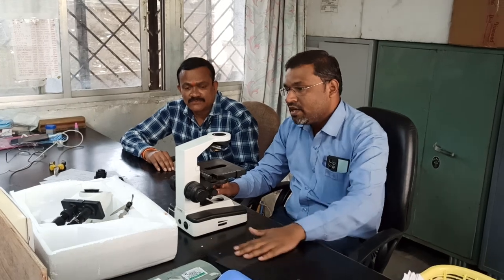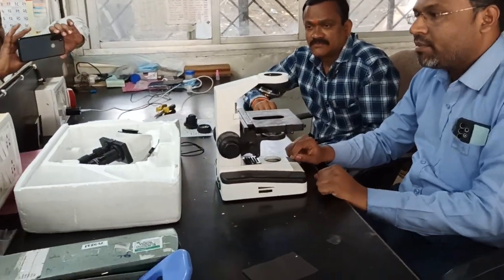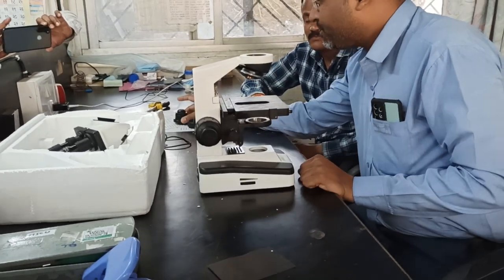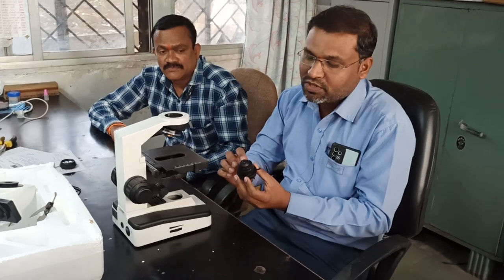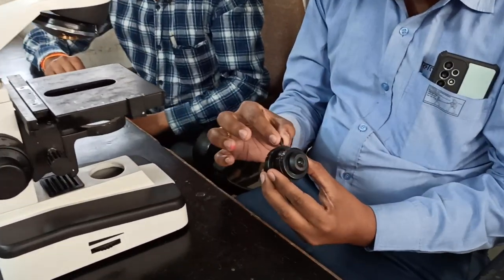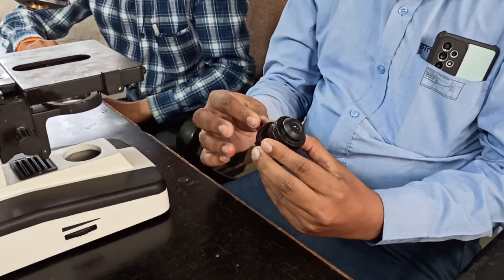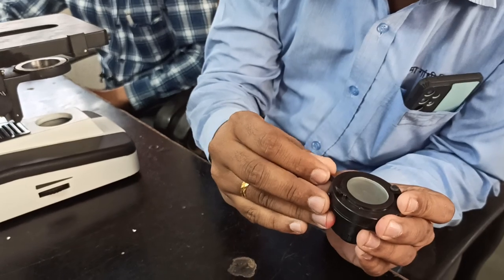I will tell you. See, this is the basic body of the microscope. One by one we are going to assemble it. So first, this is nothing but your condenser, right? You can observe here, come close. It has one adjustable knob, right? To adjust the view, you can adjust the view from this.